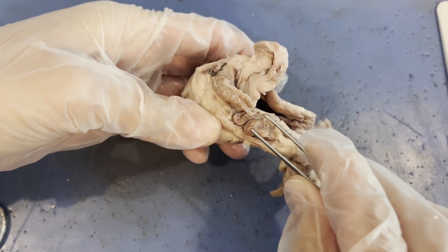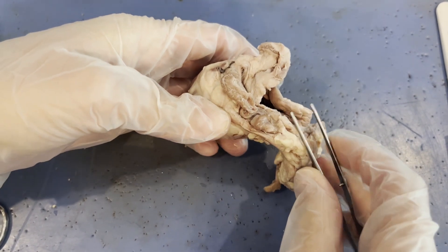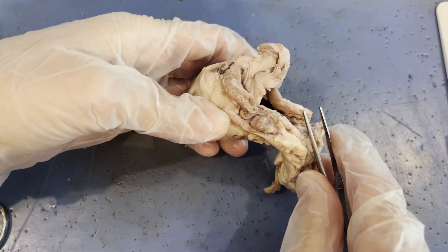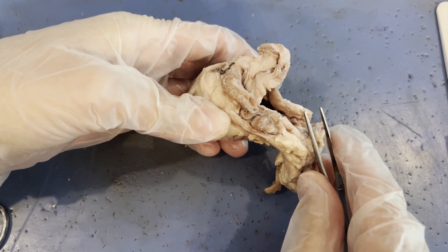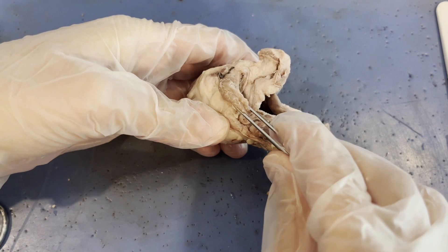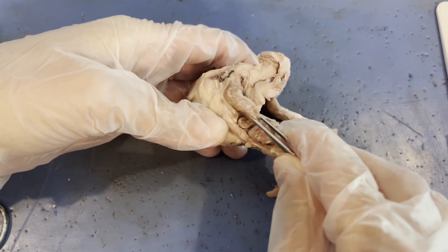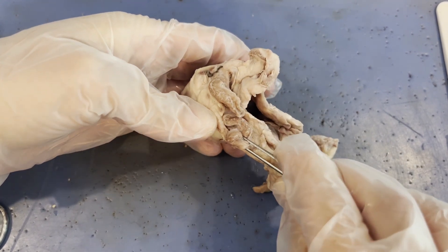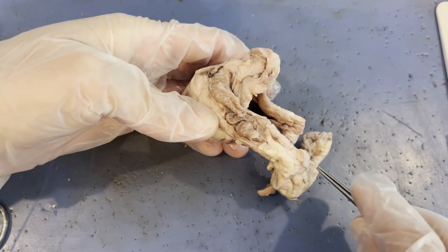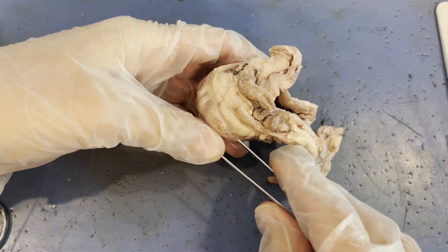These voluntary muscles are responsible for moving your eyeball within the socket. So when you look left at the person next to you without moving your head, or you look right to give someone some side eye, or you look up or down, you are contracting and relaxing your extraocular muscles. There are a number of them surrounding the eyeball and they all work in sync to give you a wide range of motion.